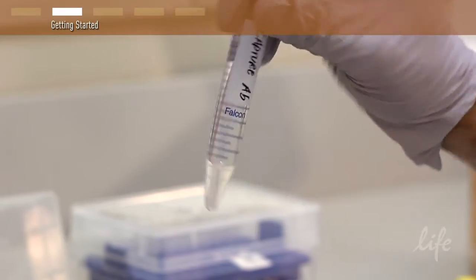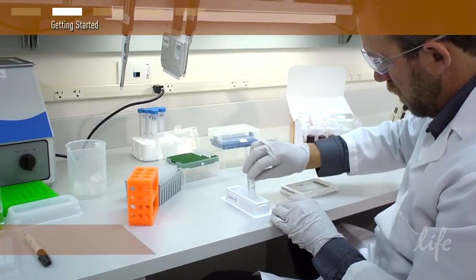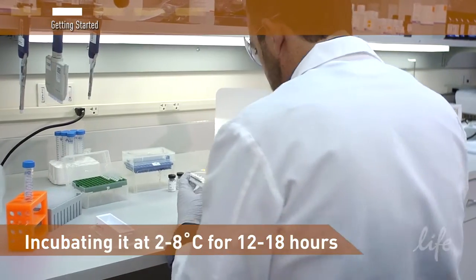After addition of the capture antibody to the wells of the plate, allow the antibody to bind to the plate by incubating it at 2 to 8 degrees Celsius for 12 to 18 hours.